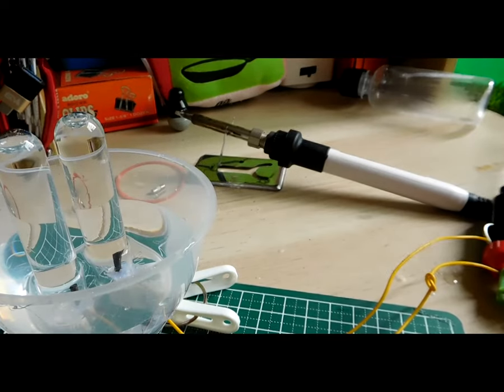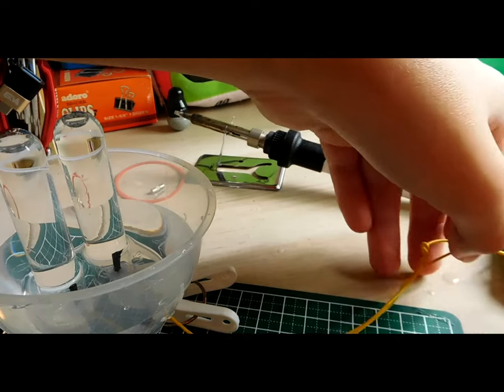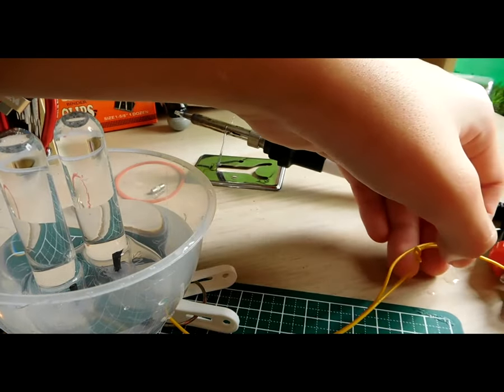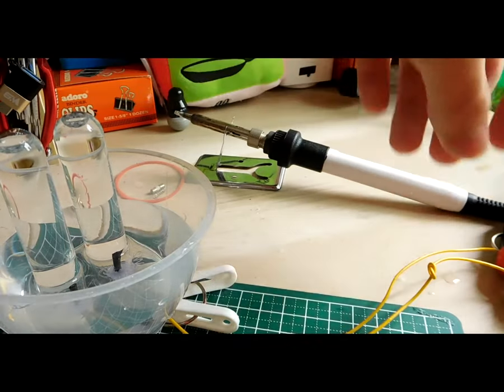Once the power supply is flipped on, we can see that there's barely any bubbles forming, and this is due to the fact that water is a very poor conductor of electricity. Don't worry, that doesn't mean that we have conducted the experiment wrongly.